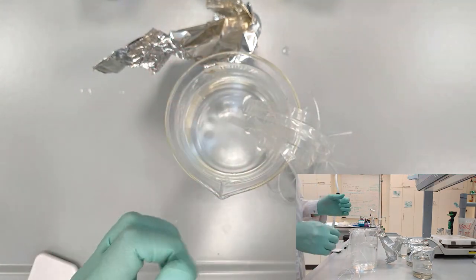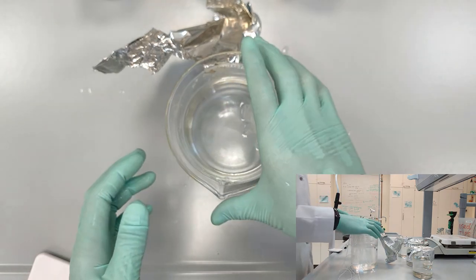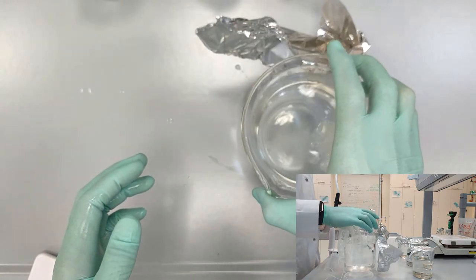Okay, after everything is ready, we can proceed to filling up these dialysis tubes. So we start with the concentration 1.2 moles per liter.